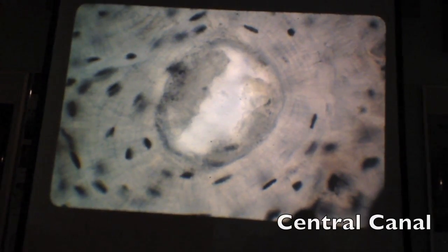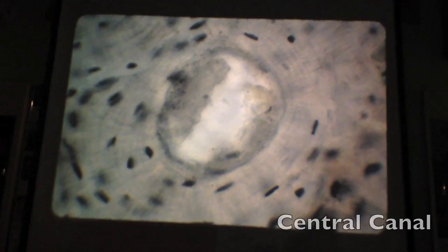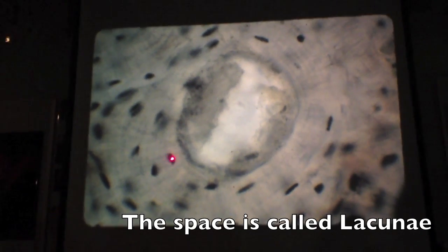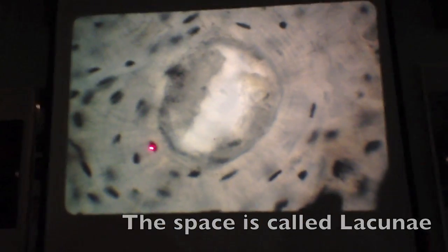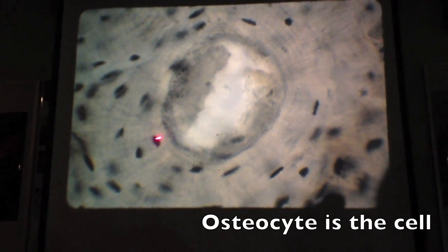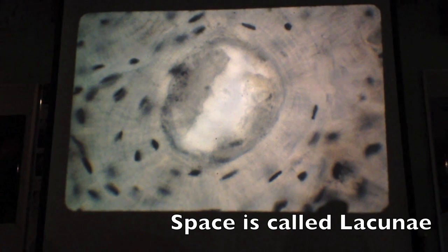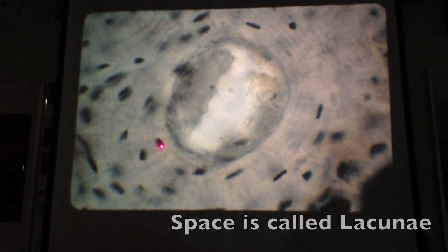What's this? Bone. Okay. And what's this big hole called? A Haversian canal or Osteon canal or central canal. What are these black spots? That's an ambiguous question. Okay, what is the space? If this black spot is a space, what is it called? Well, the cell is called an osteocyte, but if it's a space, it's called a lacuna. So on a quiz, if I point to this and say name the space, you say lacuna, name the cell osteocyte.